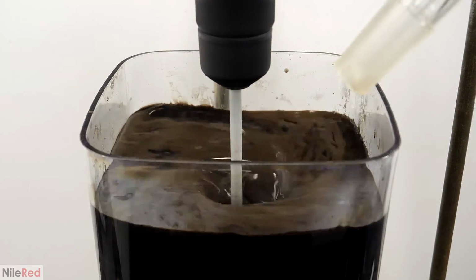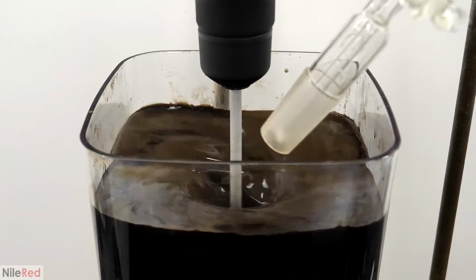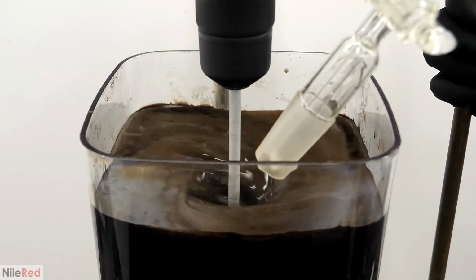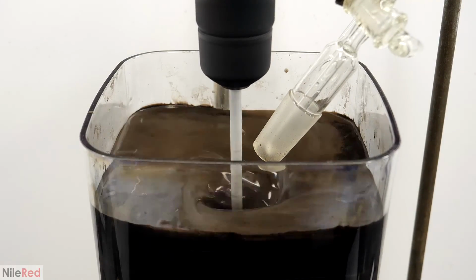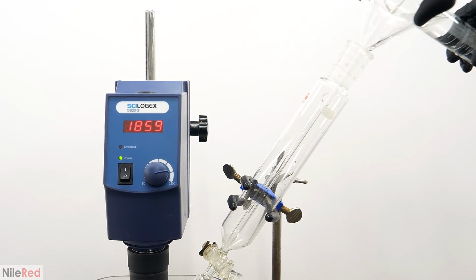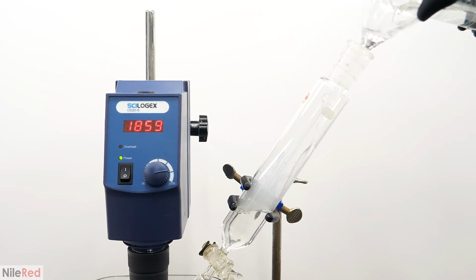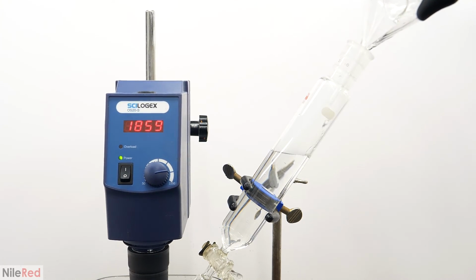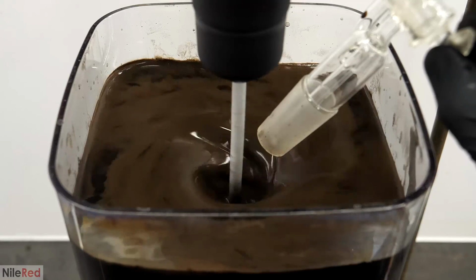I originally took away the funnel because as this whole thing mixed, it slowly puffed up with foam and I didn't want it getting in the way. But now that it was almost done and it seemed to be relatively stable, I brought it back. This time though, instead of filling it with concentrated ammonia, I did it with dilute muriatic acid. This was made by just mixing 1 volume of the concentrated acid with 2 volumes of distilled water. Then once it had been about 20 minutes, I started adding the acid.